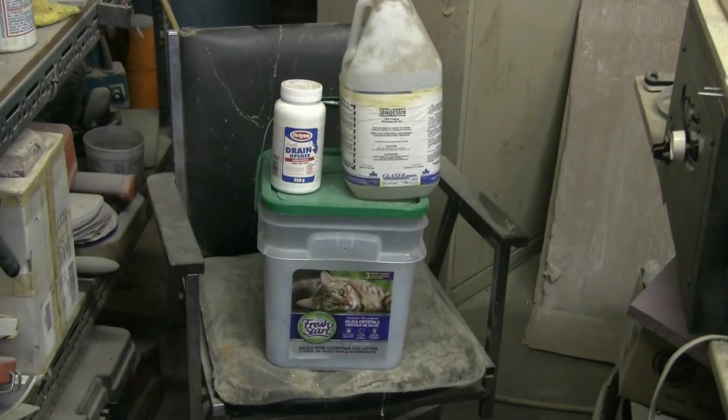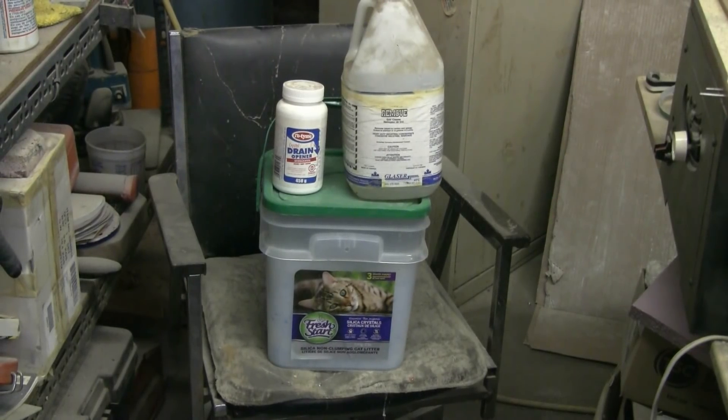Sodium silicate is a very useful chemical for working with forges and foundries and making up refractory of various types. I always use sodium silicate and it was a little expensive to buy locally, so I've gotten into making my own, which is actually quite simple.